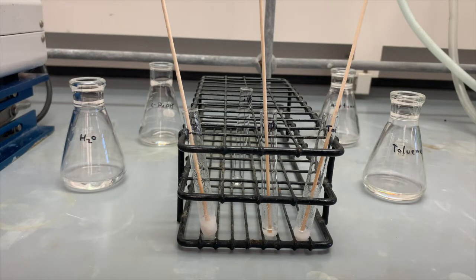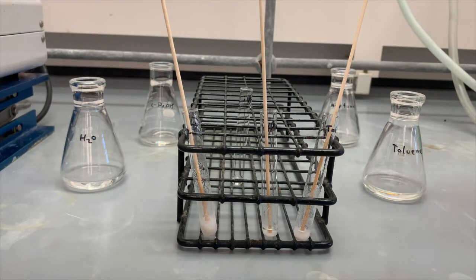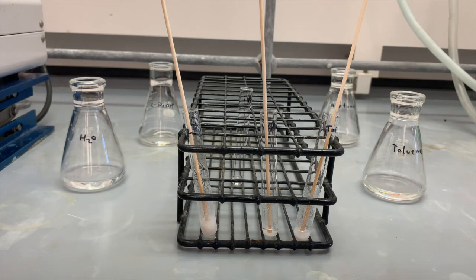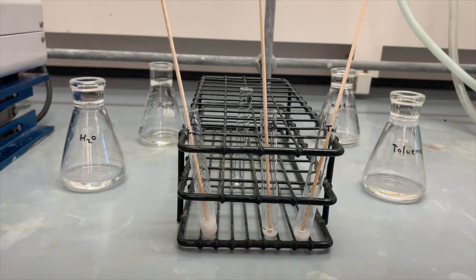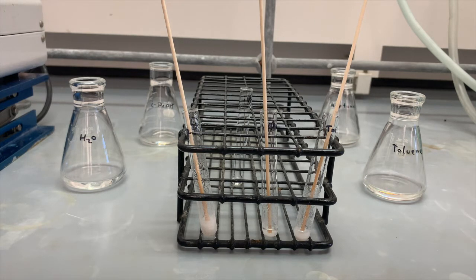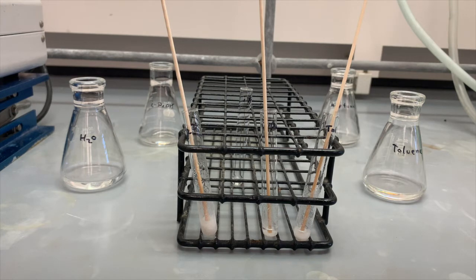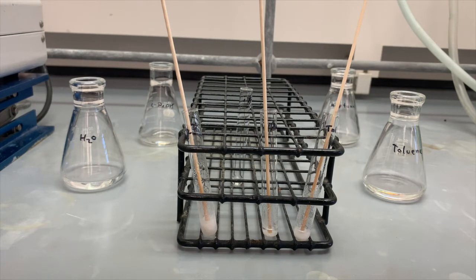Here is our water sample which shows a high degree of crystallization upon cooling. Here is our heptane which also shows insolubility upon cooling, but that also did not dissolve at high temperature anyway. And the toluene, which showed nice precipitation — insolubility at room temperature but solubility at elevated temperature. So we could pick water or toluene. Because water is safe, I'm going to choose water as the better option. Toluene isn't a particularly dangerous compound but it is flammable and there are risks associated with it, so I'm going to pick water.